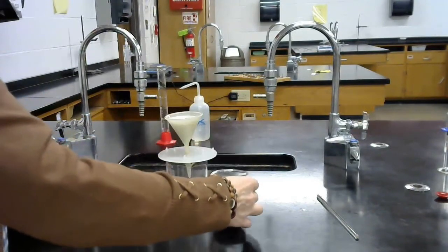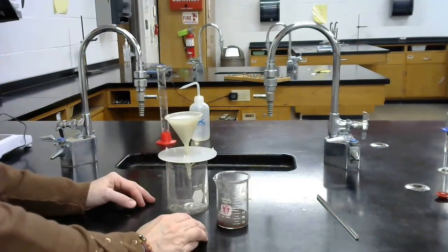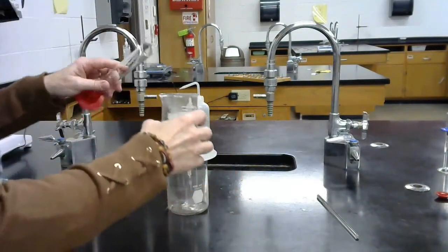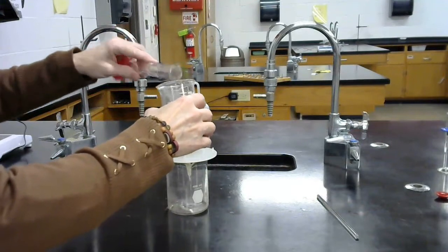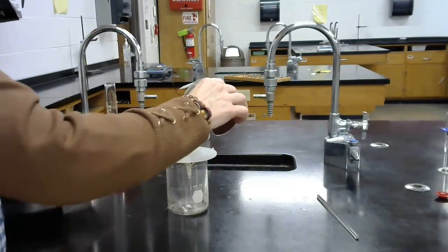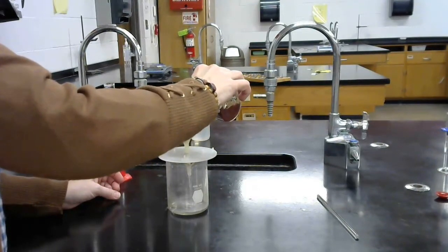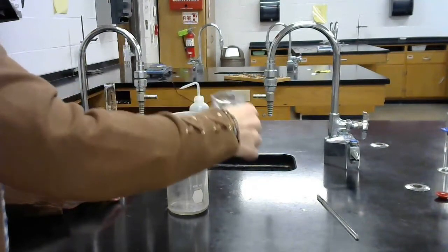And it's going to take a little time of filtering. Once we filter this, we're going to wash it with a little bit more water here just to make sure that it's clean. And we're going to continue to filter.